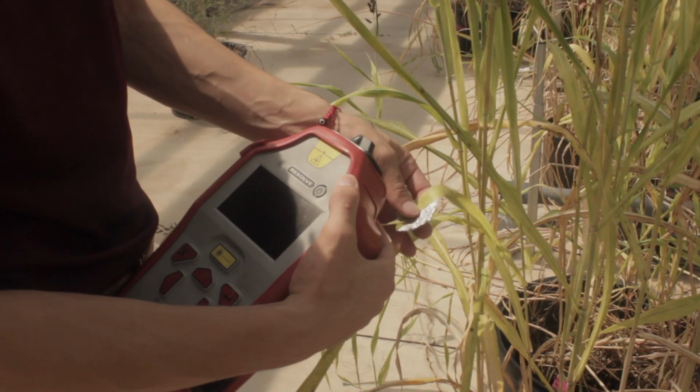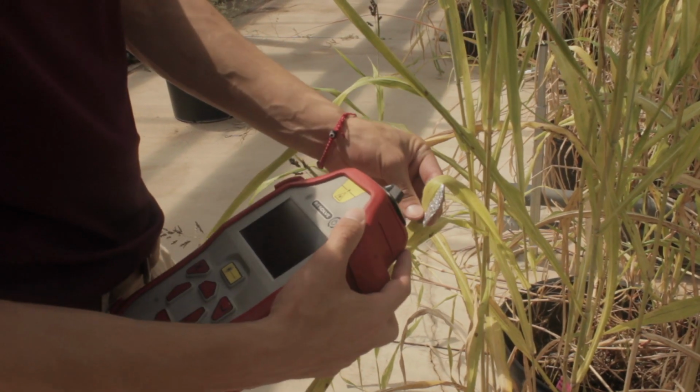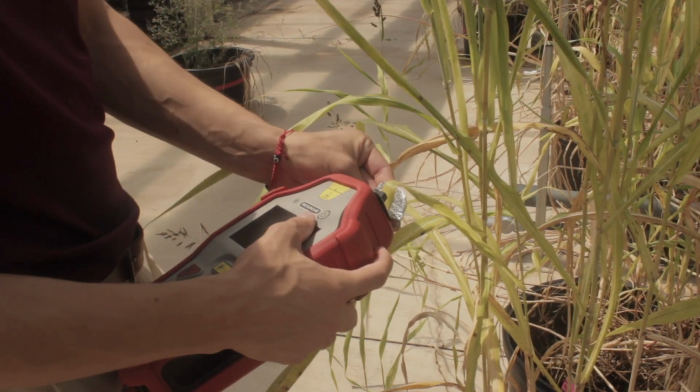Using the handheld Raman spectrometer, we've been able to detect and characterize different types of stress that hemp experiences before visible signs of stress appear. This makes growing hemp easier and cost-effective when specific stressors such as light, heat, or water stress are experienced by the plants. Overall, this technology is easy for both students and private sector employees to use, and there's lots of room for improvement and innovation.